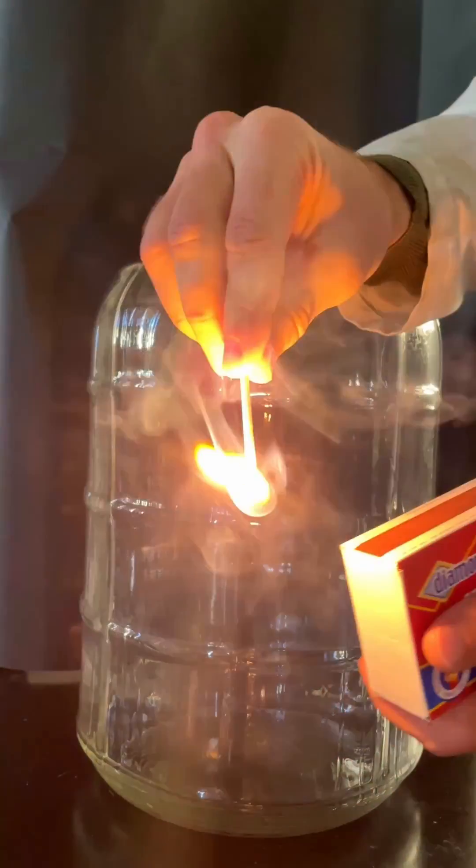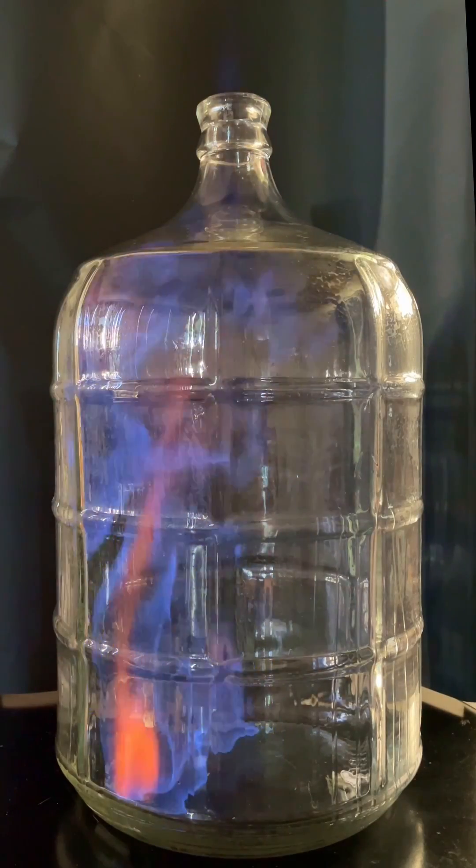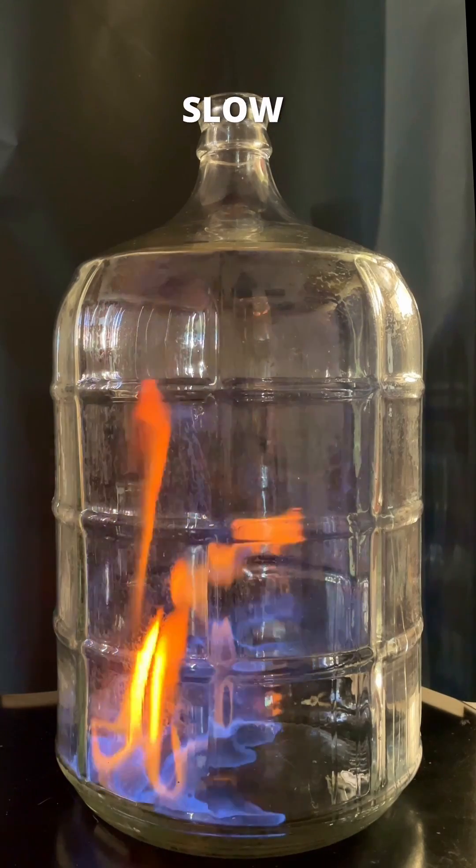If you put the alcohol in the bottle, we can start to see what happens. The first one is slow. This is when the alcohol is warming.